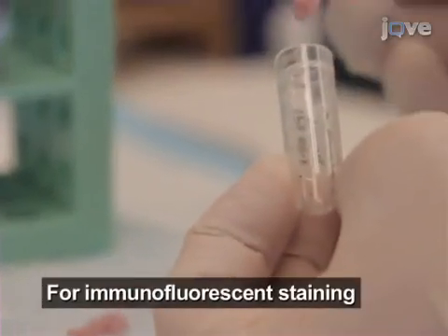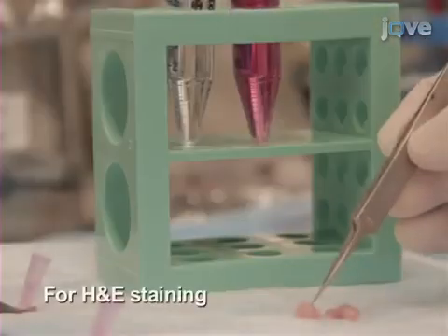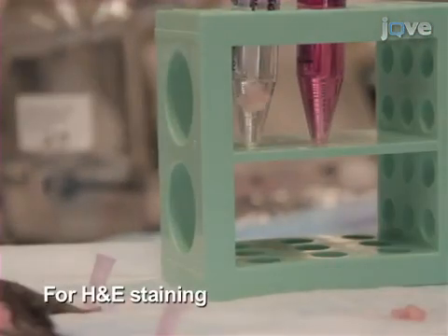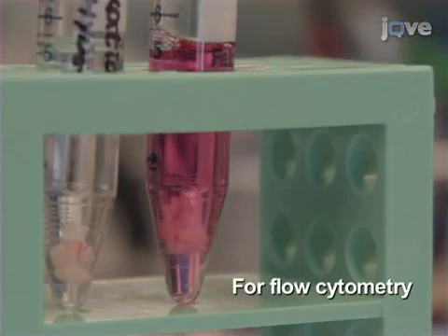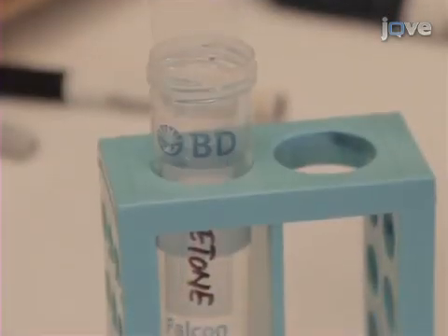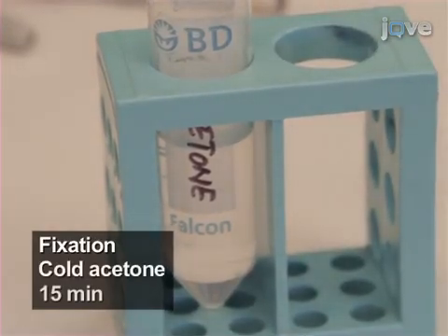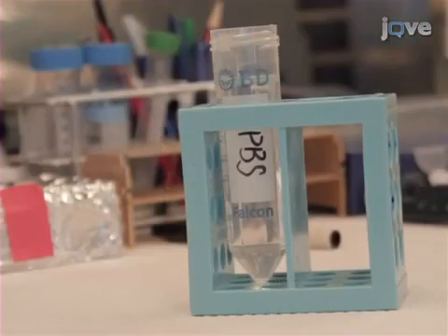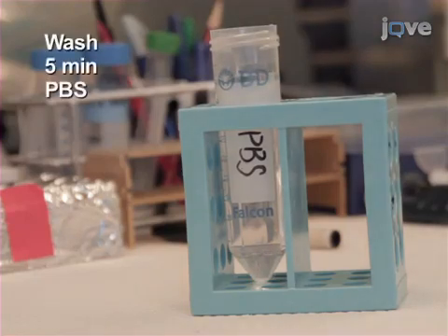Place the first tumor piece into a cryovial and place the vial on dry ice immediately. Fix the second piece in formaldehyde. Preserve the third piece in conditioned RPMI 1640 media. After air drying the cryopreserved tissue sections, fix them in cold acetone for 15 minutes. After air drying the fixed sections for another 15 minutes, wash the slides for 5 minutes in PBS.